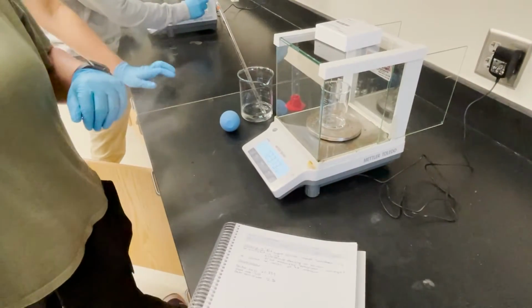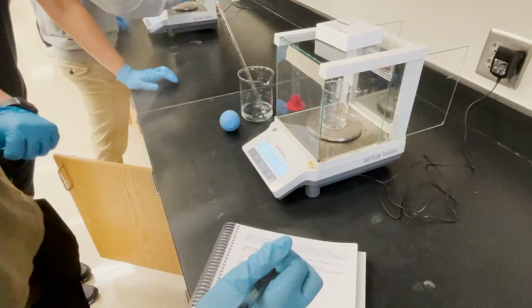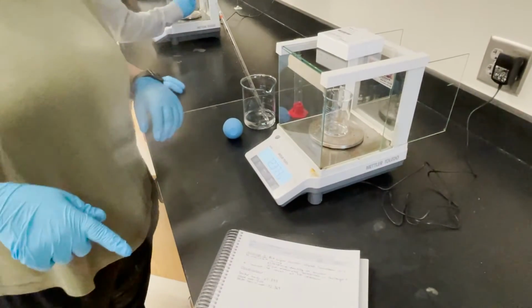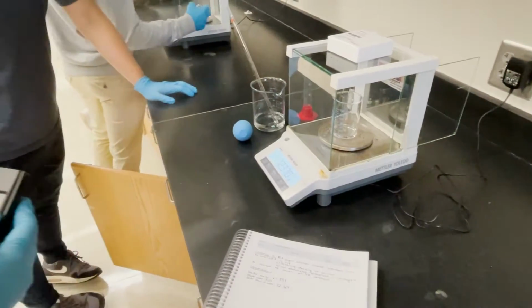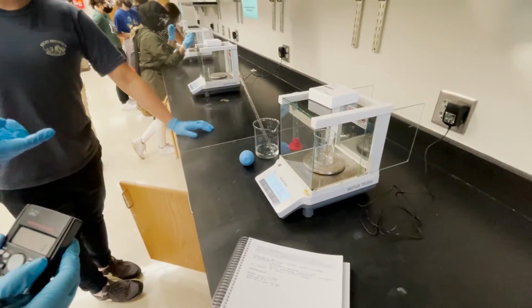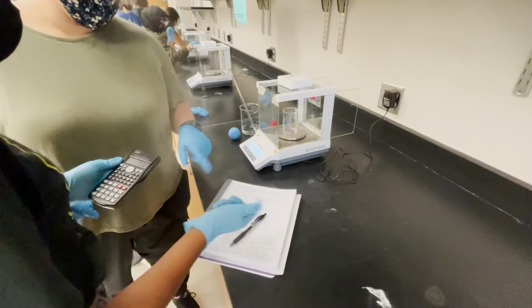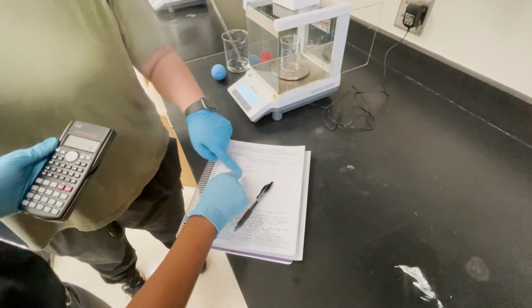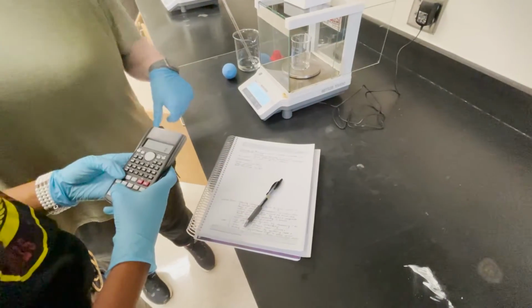The stock solution in Challenge 2 will keep its same concentration throughout all 4 trials. The only thing we changed is how many milliliters of the stock solution was added to however many milliliters of water to equal a total of 25 milliliters of product each time. When adding the different amounts of water to the stock solution, we are practicing dilution.